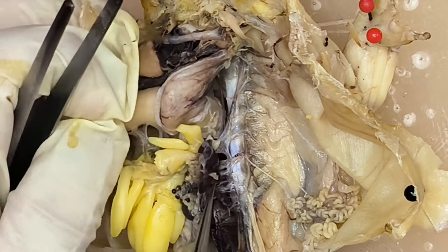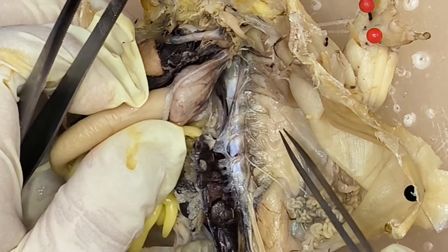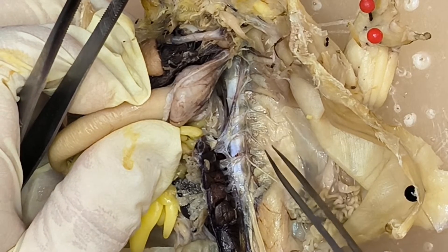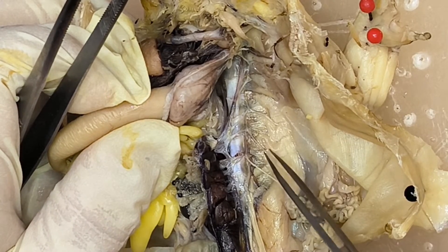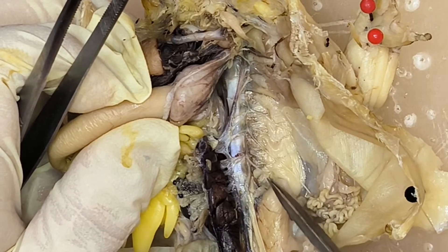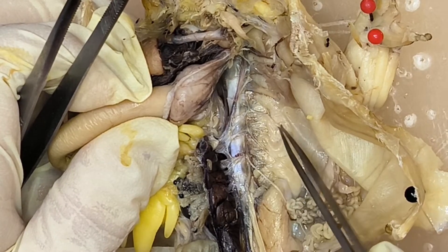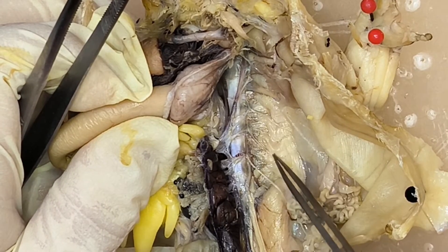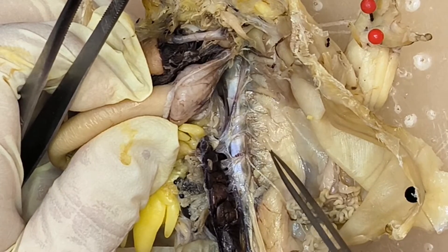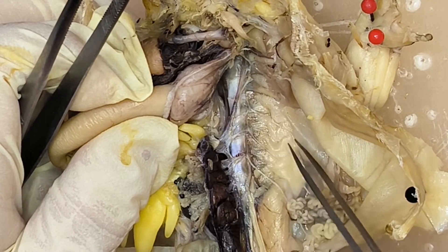Then you have here the fourth, the fifth, and the sixth spinal nerves. These innervate the skin and muscles of the abdominal area.